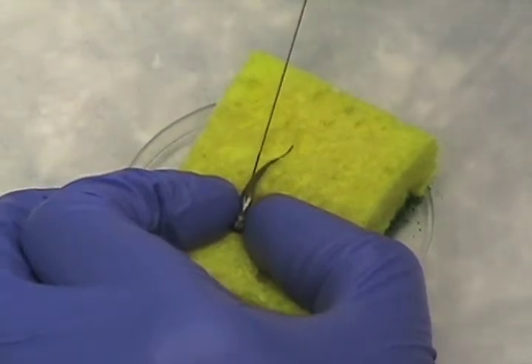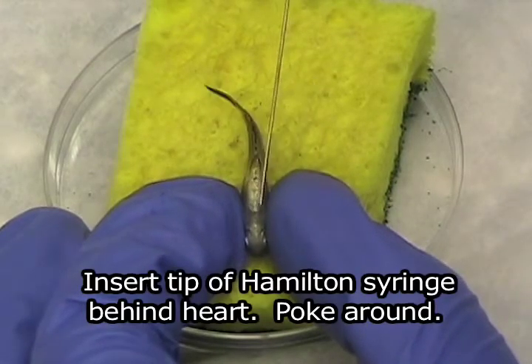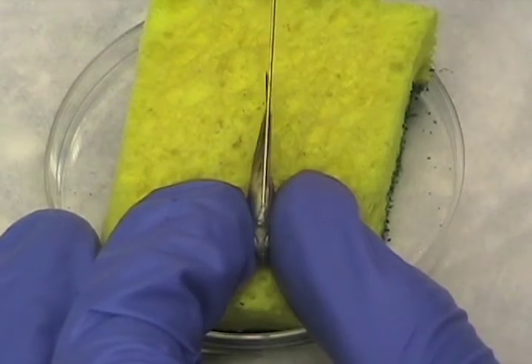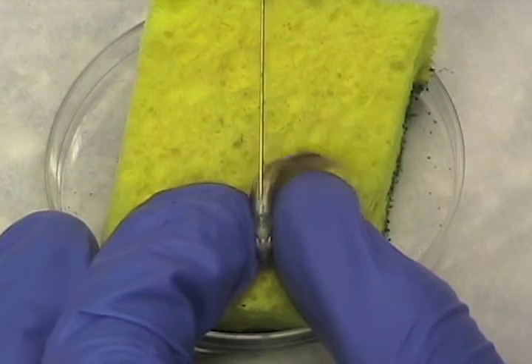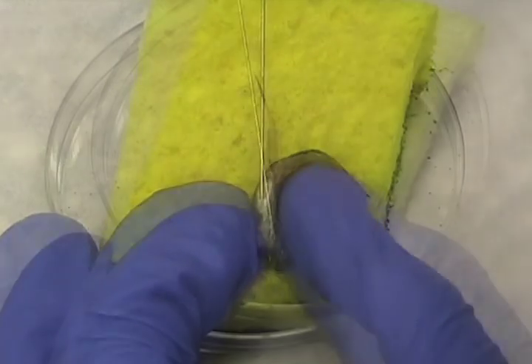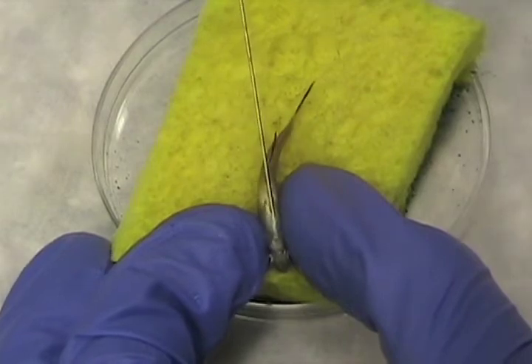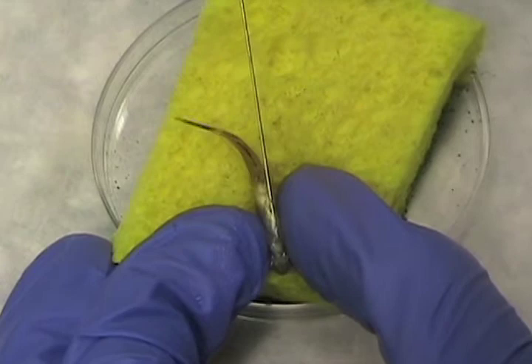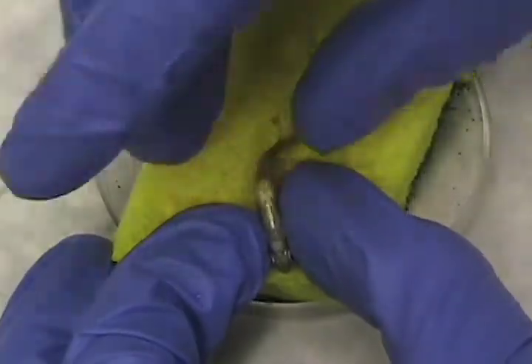I'm going to insert the syringe a little ways back. The heart is about here, so that's where I want to end up. I'm going to poke it in, staying very shallow, and then I'm going to aim right here where the heart is. Sometimes you see a burst of blood, which means you hit the heart. Sometimes you don't. I'm not seeing any blood, so I'm just going to inject. That's it.